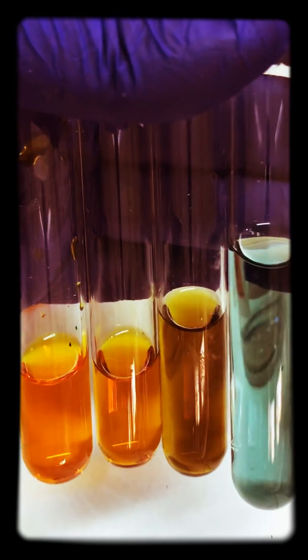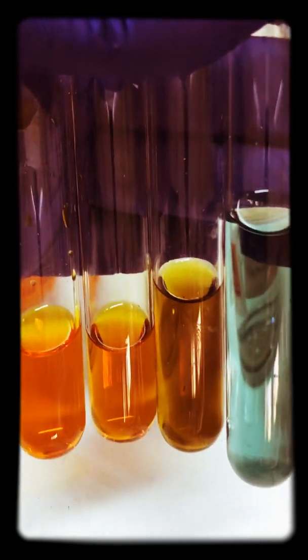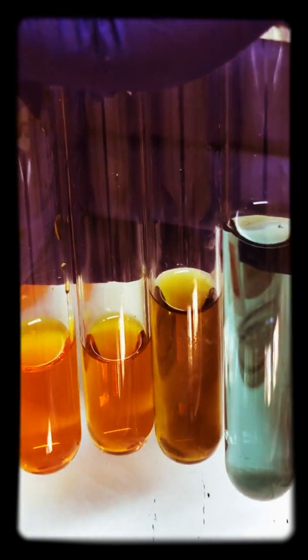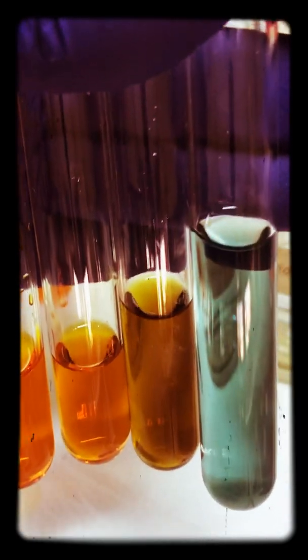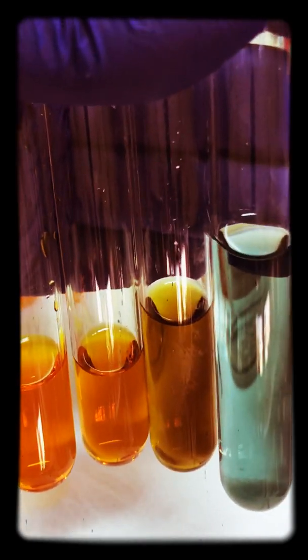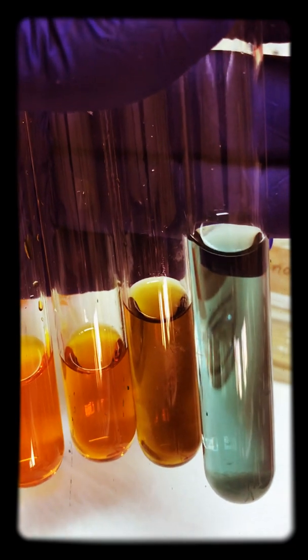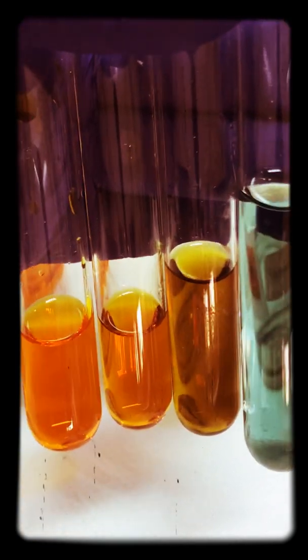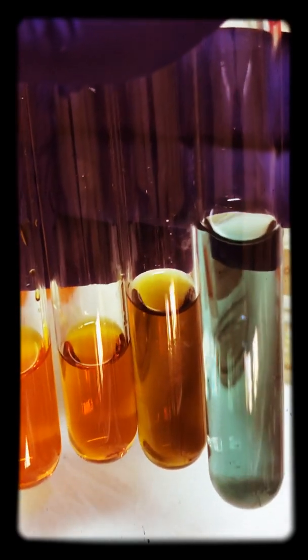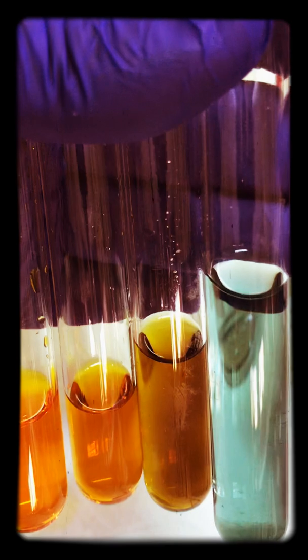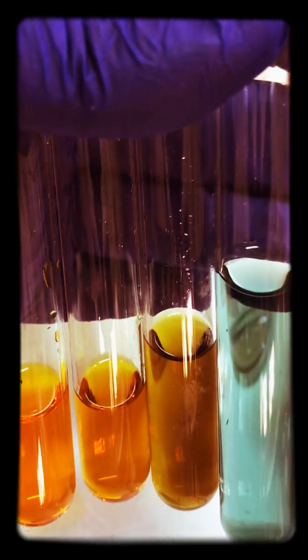You definitely need to be able to recognize the color changes from orange to green, signifying the chromium's oxidation state is turning from plus six to plus three. The chromium is gaining three electrons, which is a reduction. Remember that oxidizing agents get reduced themselves and they oxidize another substance.